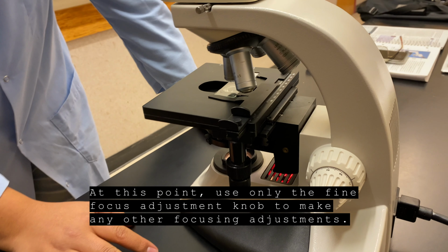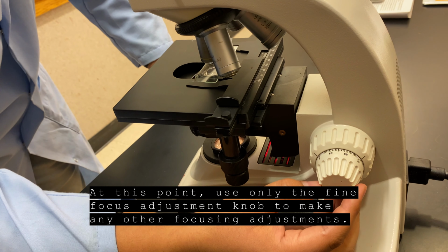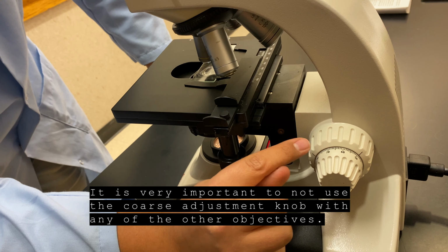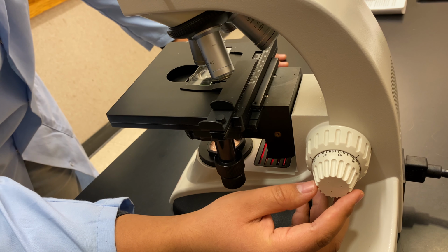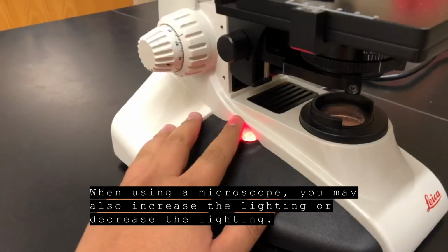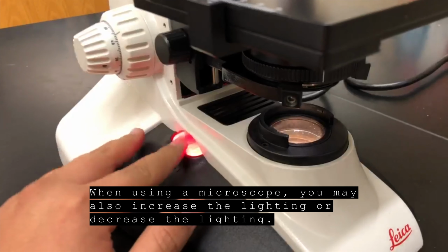At this point, use only the fine focus adjustment knob to make any other focusing adjustments. It is very important to not use the coarse adjustment knob with any of the other objectives. When using a microscope, you may also increase the lighting or decrease the lighting.